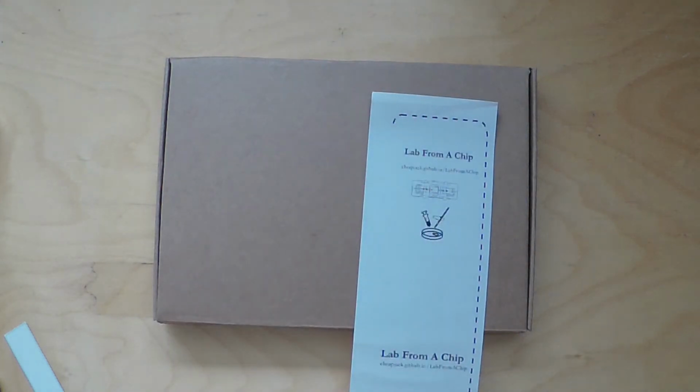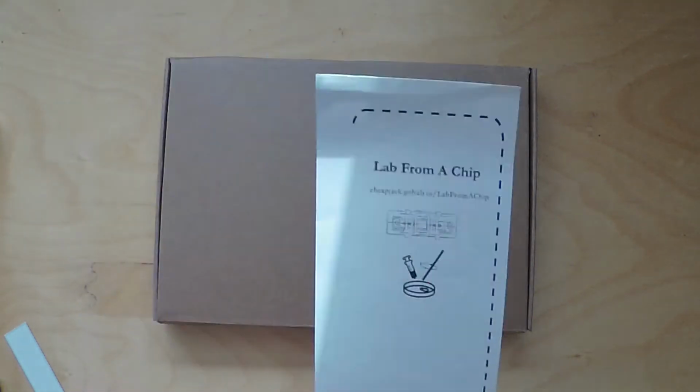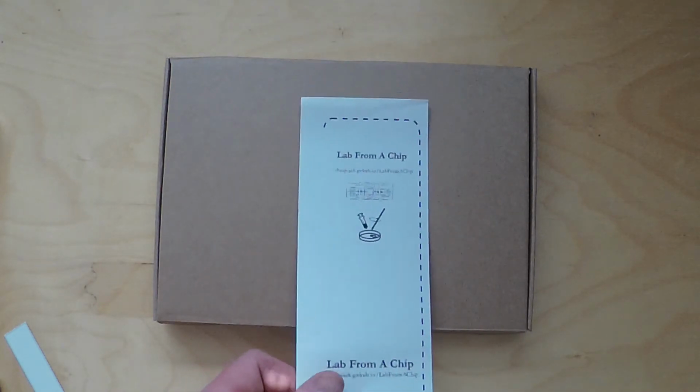You should all have received a box a bit like this one, with a lab from a chip sticker, all sealed up. What I wanted to do was a little bit of an unboxing of the kit and give you a quick guide to assembling the origami folding microscope that it contains. I'll introduce you to the other components, and then follow up with a guide to assembling the microscope, the Foldscope, which you'll find in the box.